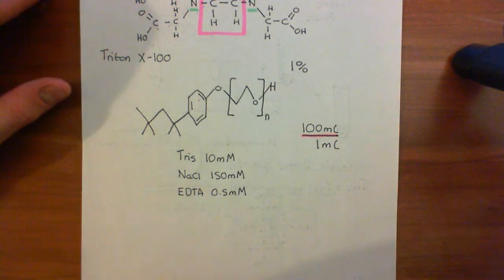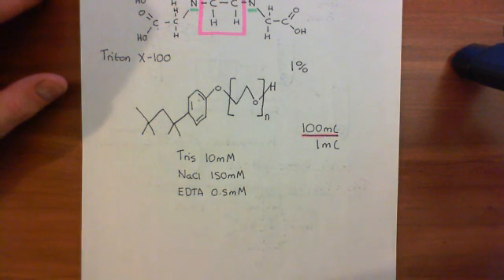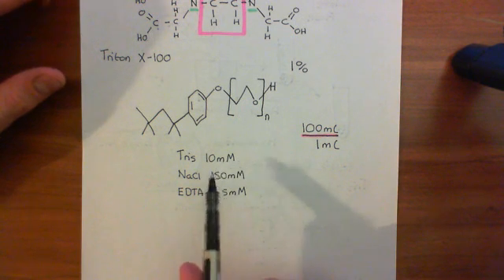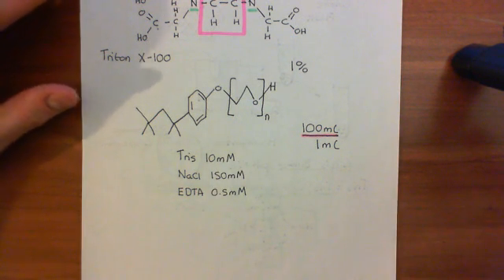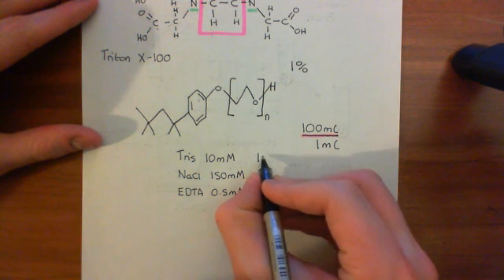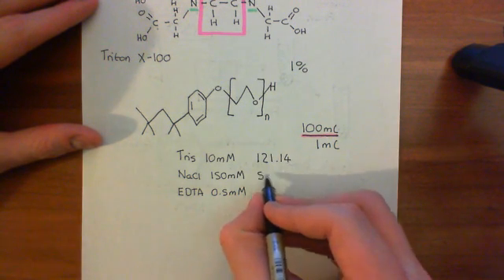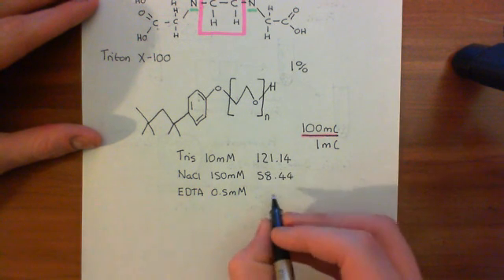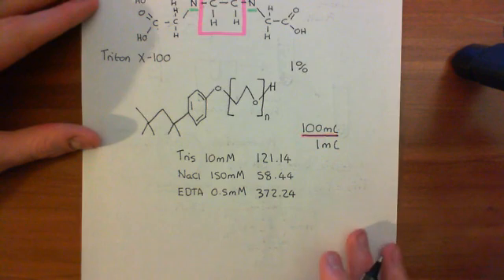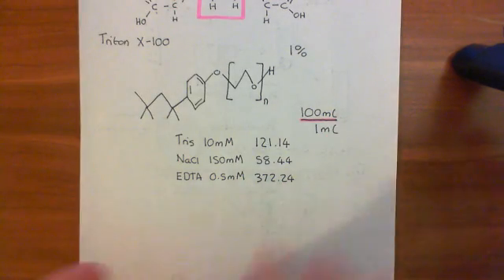Each one of these is a solid rather than a liquid, so we're going to actually have to measure out the mass that we want — we need to work out how much mass to put in to get the correct concentration. We need the molecular weights of each of these molecules. The molecular weight of Tris is 121.14. The molecular weight of sodium chloride is 58.44. And the molecular weight of EDTA is 372.24.